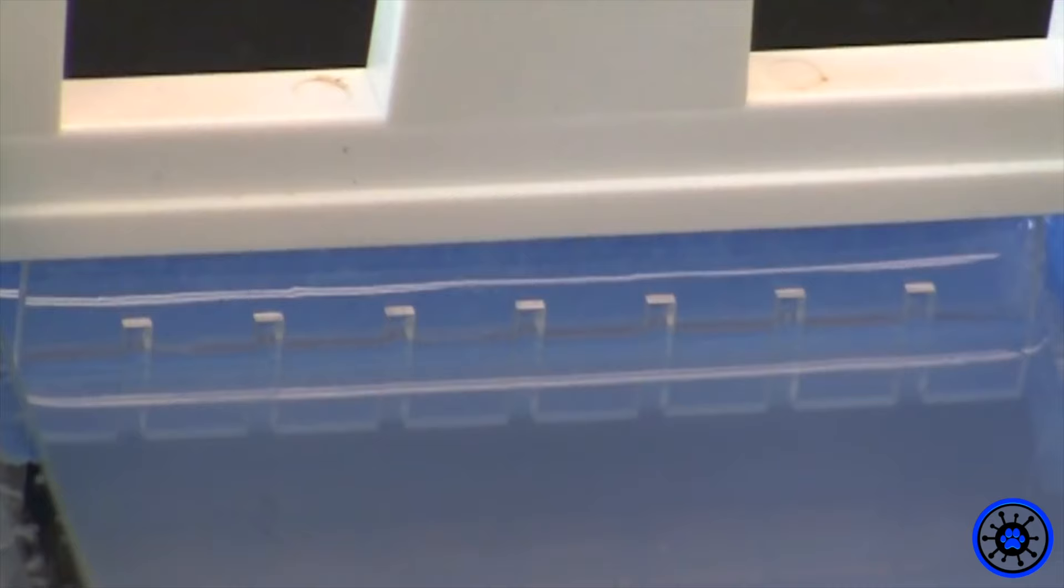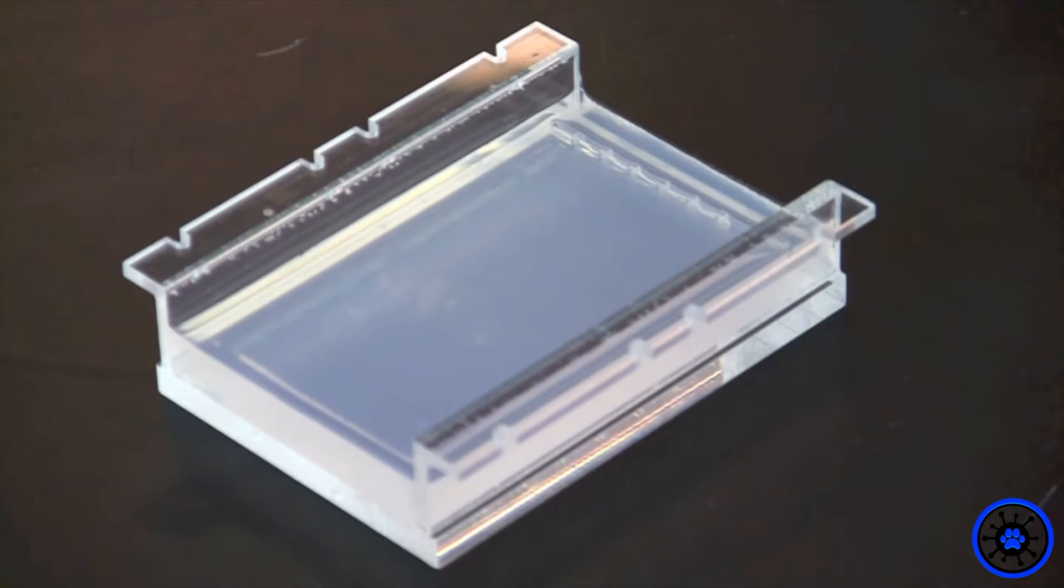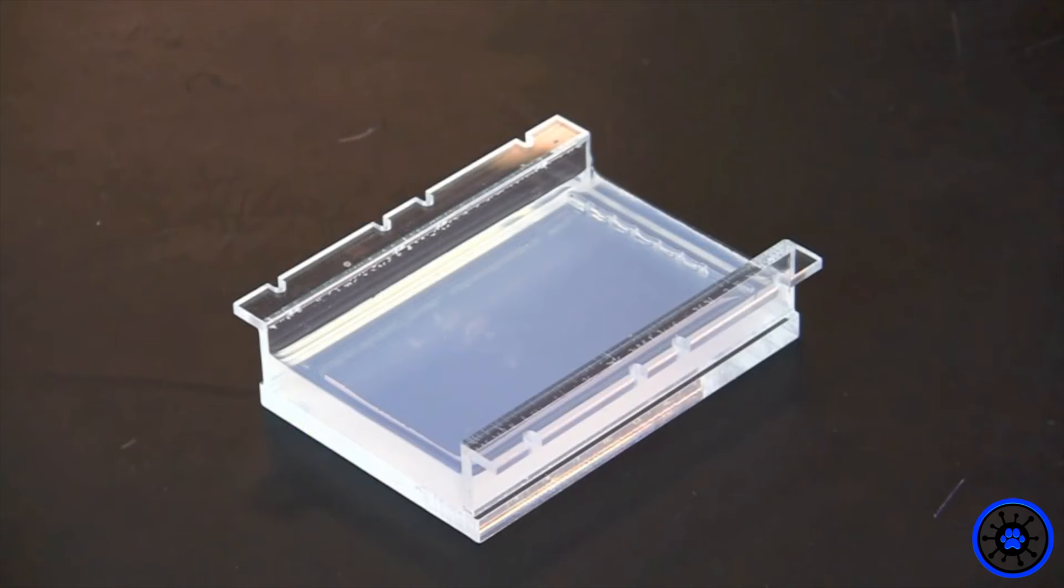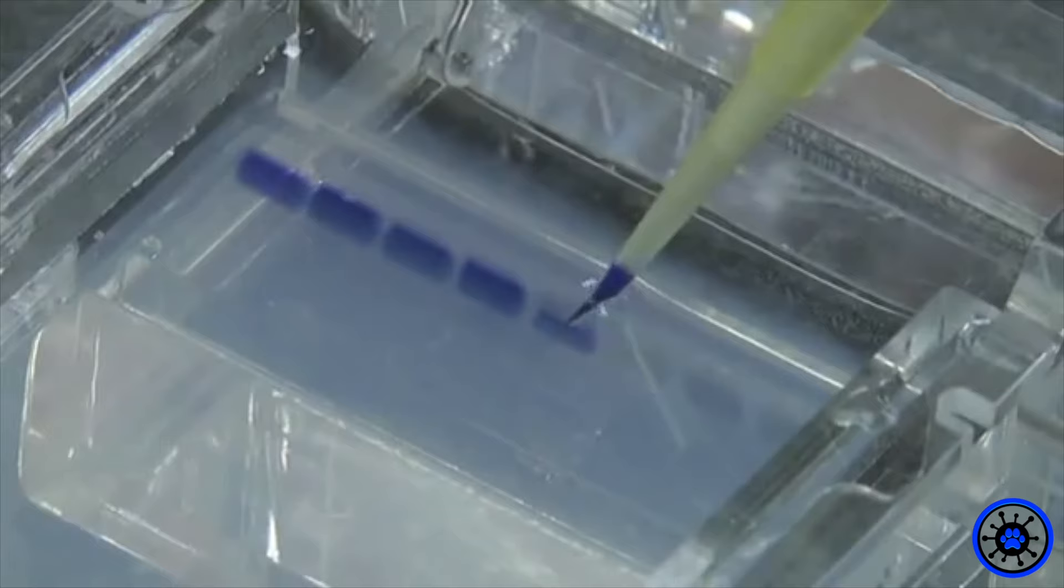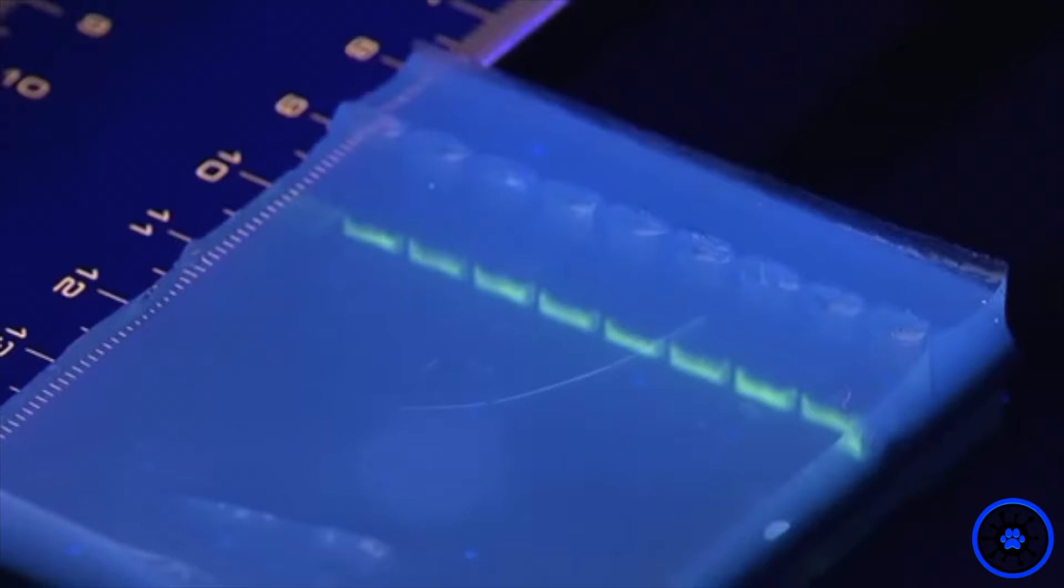Run out each cDNA sample on a 1% agarose gel. A lambda phage DNA ladder was used as a standard.